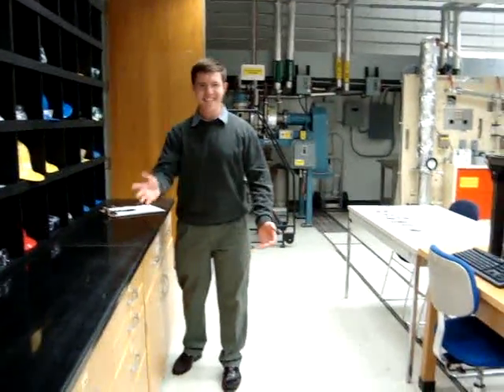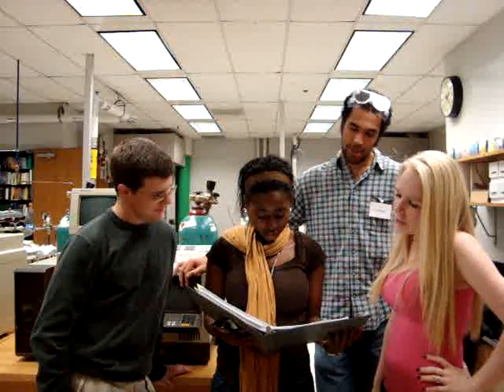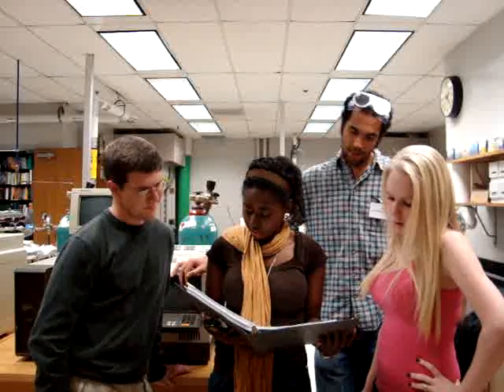Doing? Is that dancing and music and what are you guys wearing? Did you even read the safety manual? Here you go, Valencia. These are the safety protocols. Yeah. Oh, there's so many of them. No, we couldn't have been doing that much stuff wrong. Do we have to read this? I guess we should. Yeah, we probably should have read this. I don't know how to read.